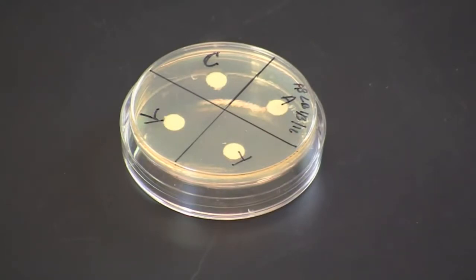Place the LB agar plate upside down in a 37 degrees Celsius incubator for 16 to 24 hours.